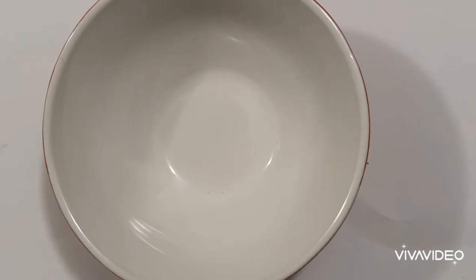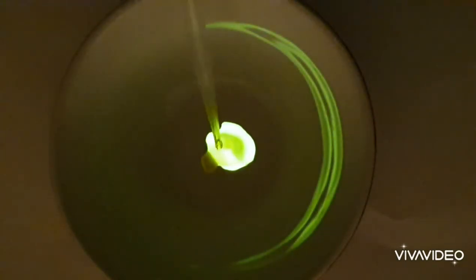In this bowl I've put the hydrogen peroxide, and you'll see that when I add the dye and the diphenyl oxalate to it, it illuminates and glows.